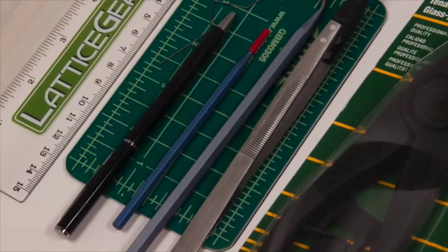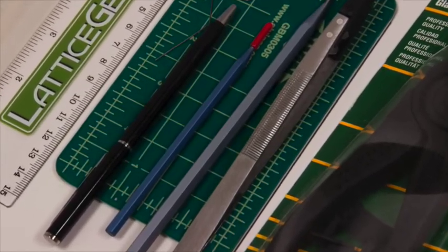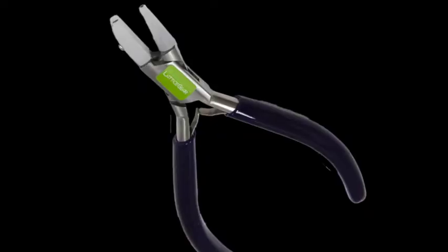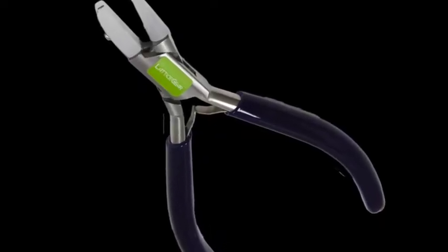The tools used in this video include scribers available in Lattice Gear's cleaving kit, small sample pliers, and Lattice Gear's flip scribe.